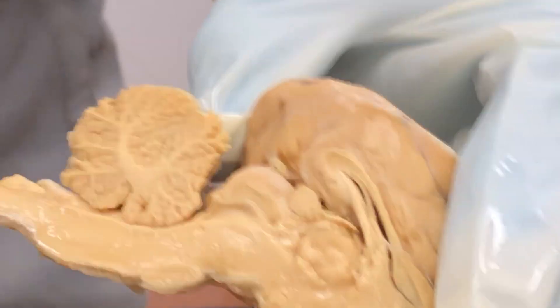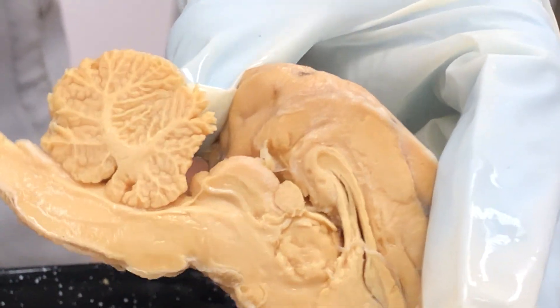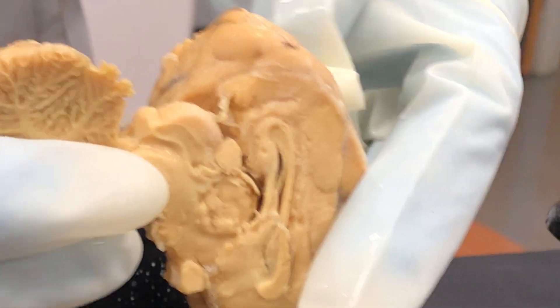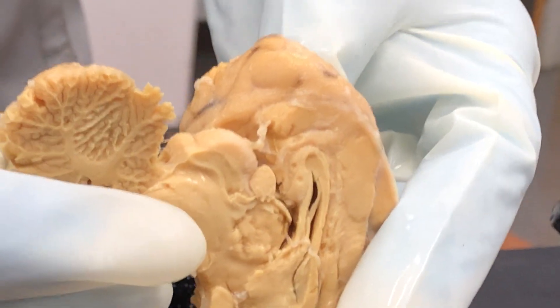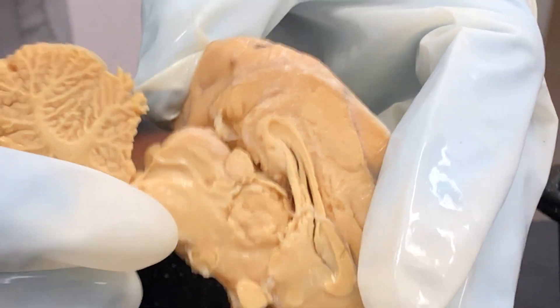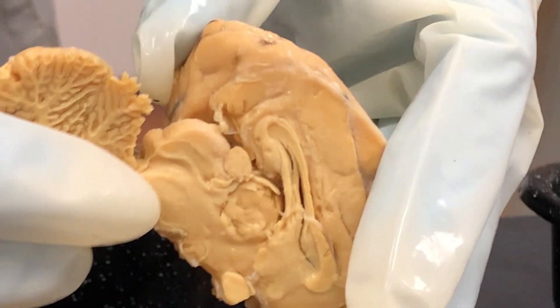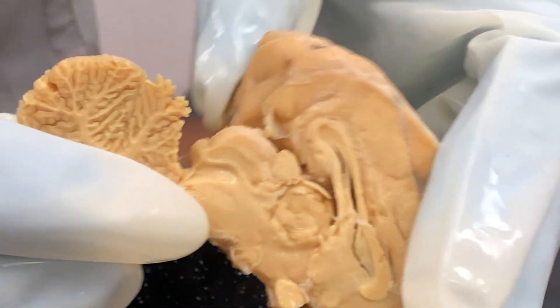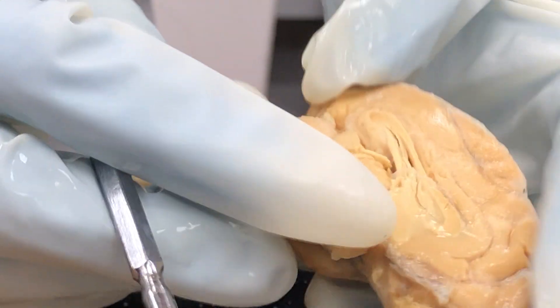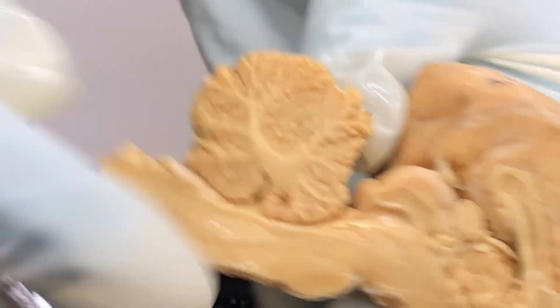Also of note, if you want to see the posterior view of the pineal gland, the lab manual has a nice picture of the complete brain with the cerebellum pulled down in which you can see the pineal gland. The next structure we're going to look at is the superior colliculus and the inferior colliculus, which is closely associated with it.